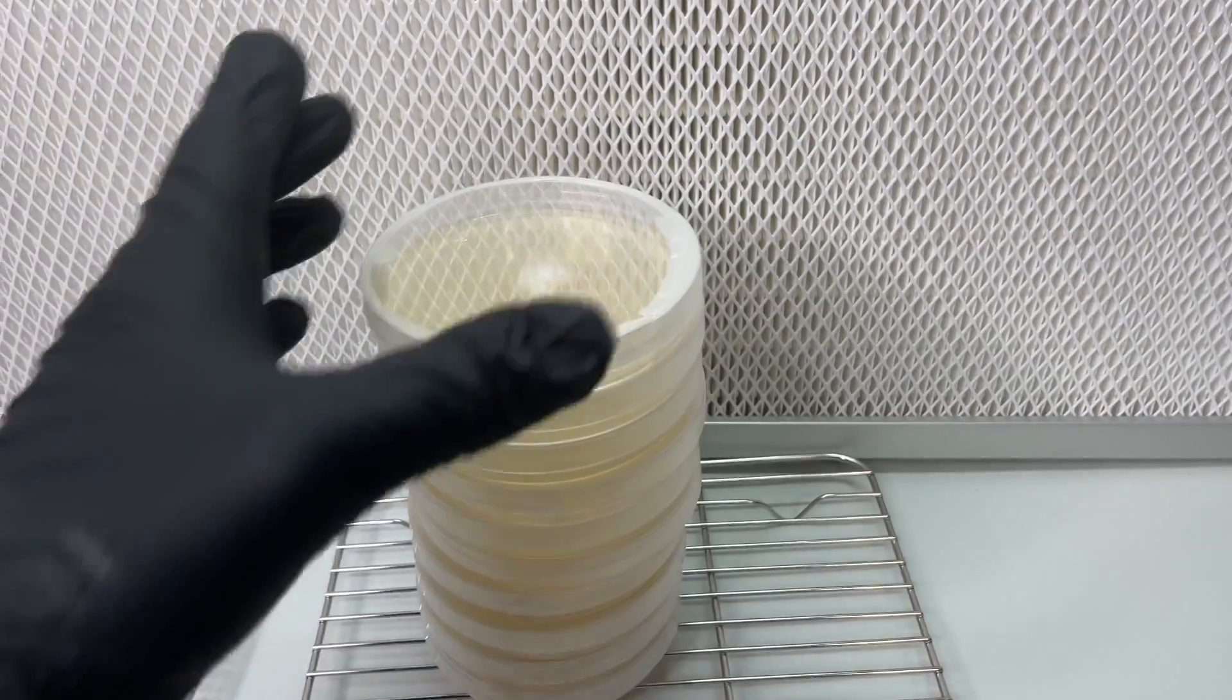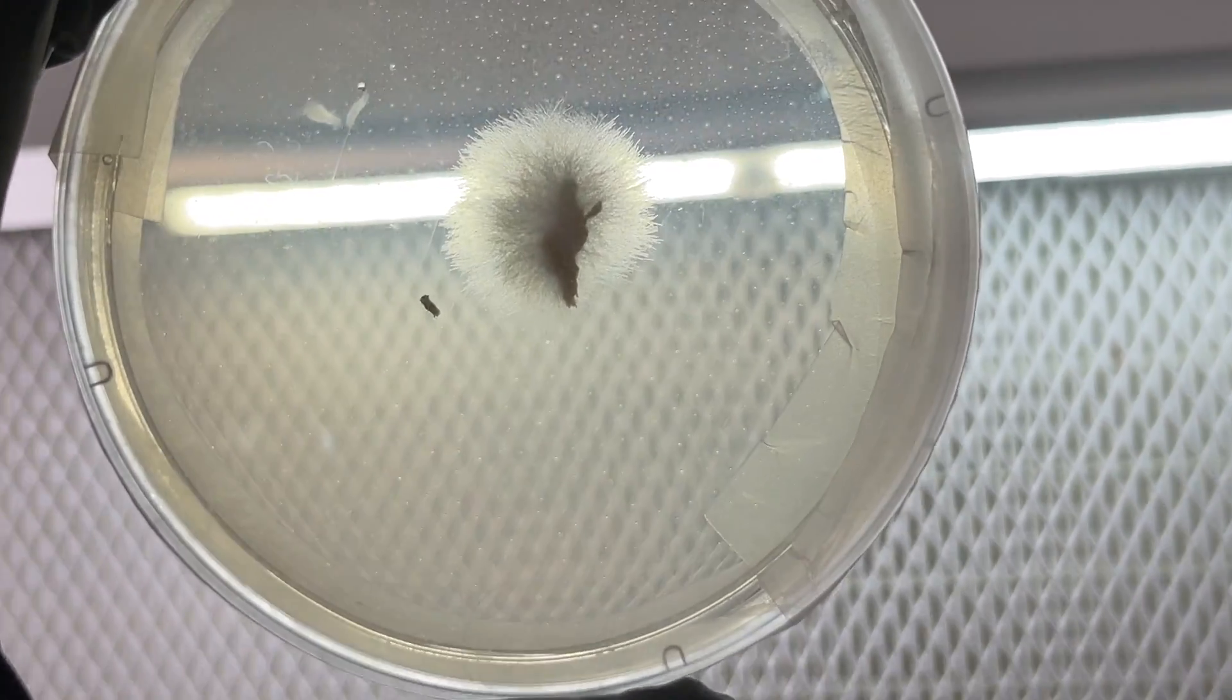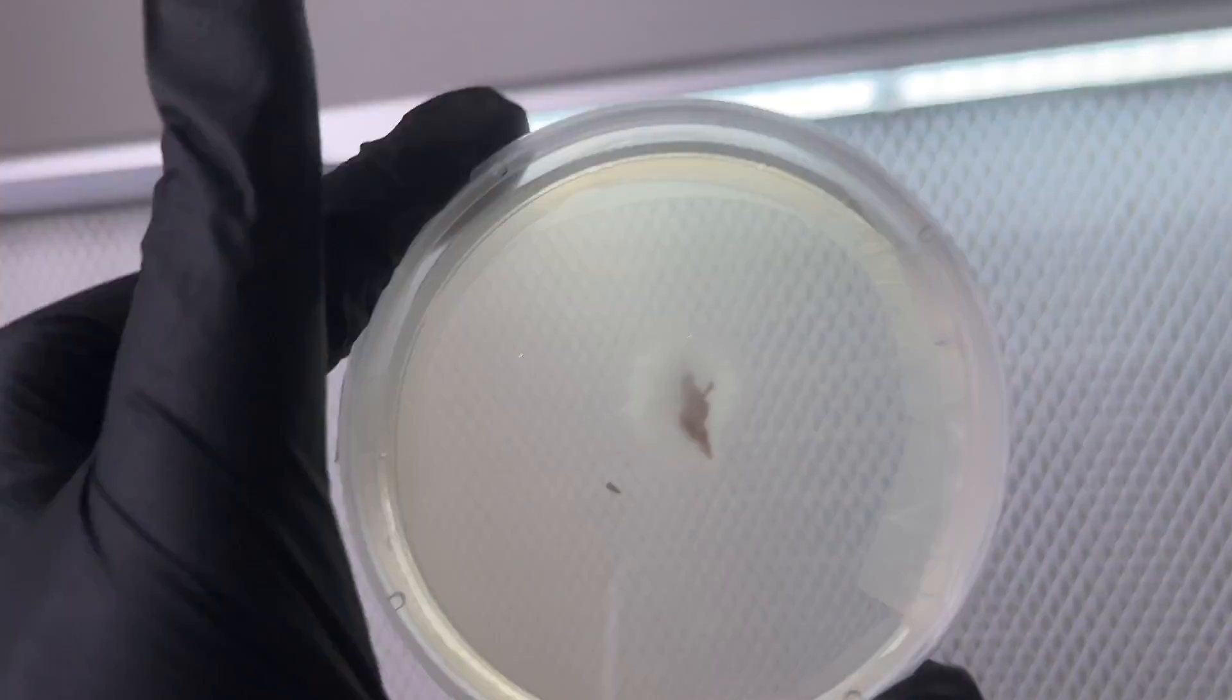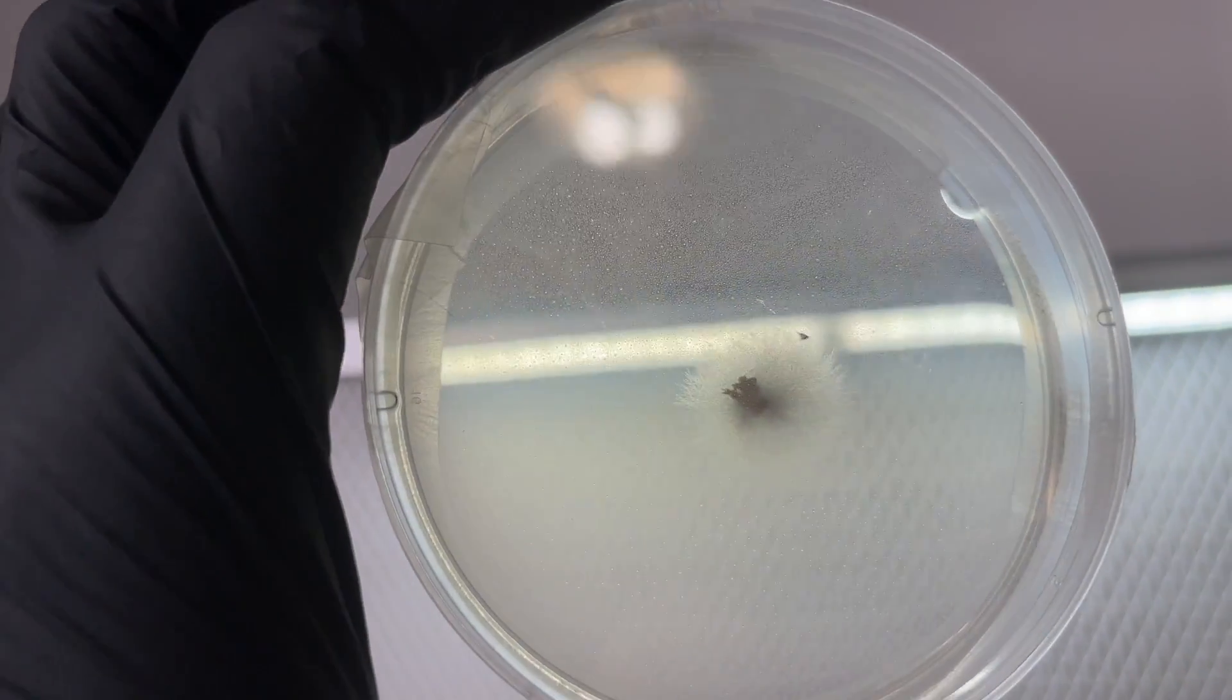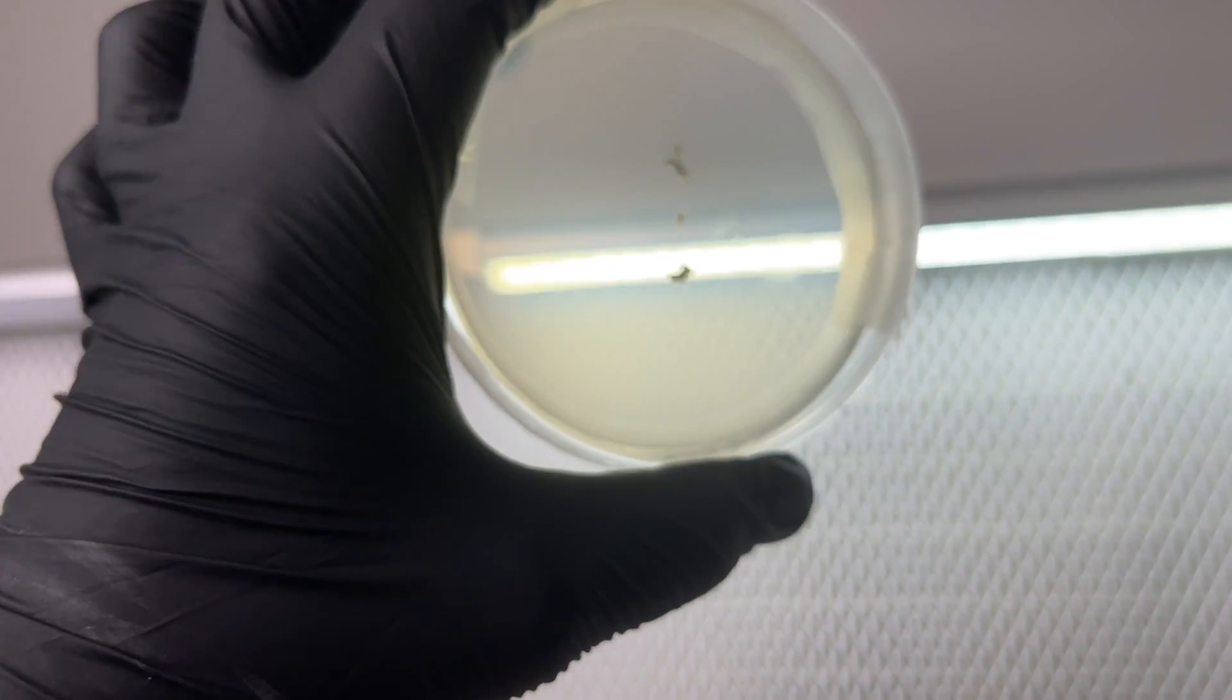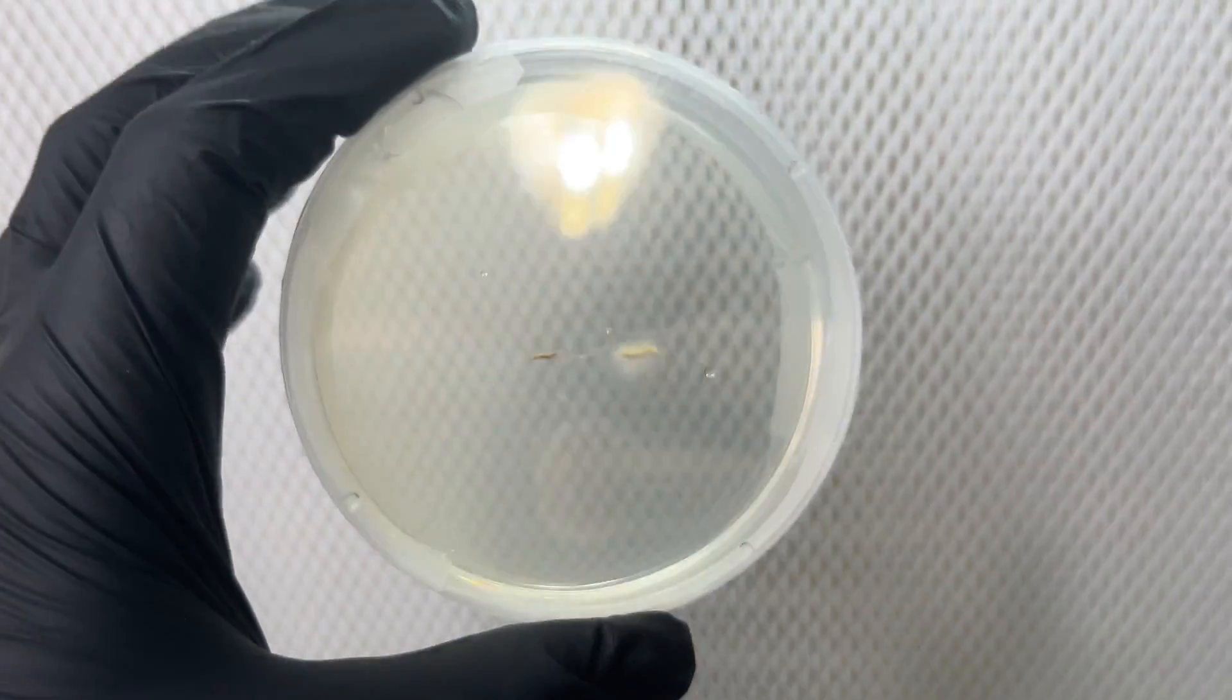Out of the 10 agar plates, three of them were successful in resuscitating the mycelium. And the other seven plates either didn't grow at all or were heavily contaminated with bacteria. With these results, I concluded that if the mushrooms are dried below 130 degrees Fahrenheit, there's a good chance that you'll be able to clone them.